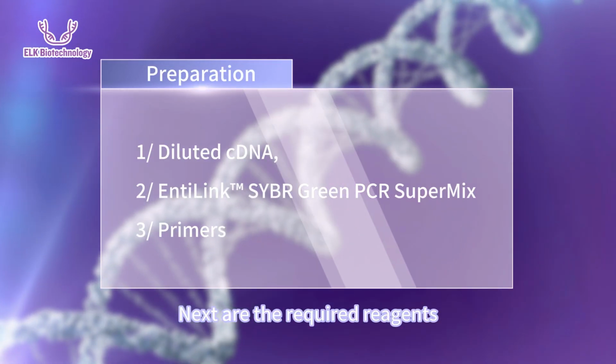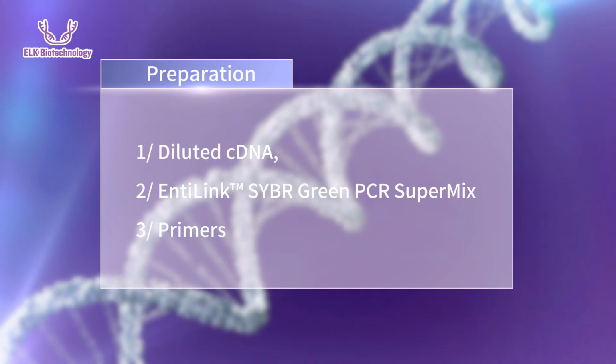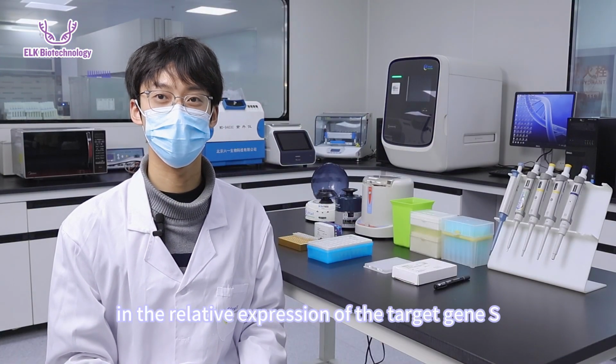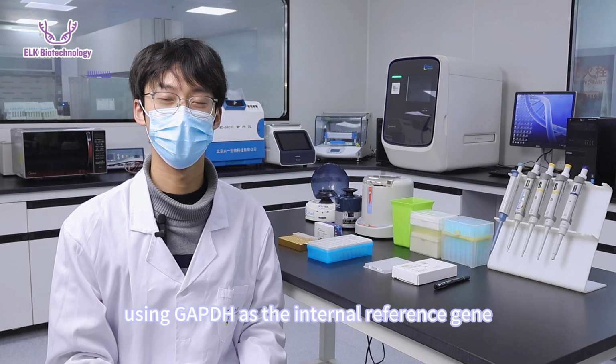Next are the required reagents. The purpose of this experiment is to detect the changes in the relative expression of the target gene S in clinical samples numbered 1 to 33, using GAPDH as the internal reference gene.